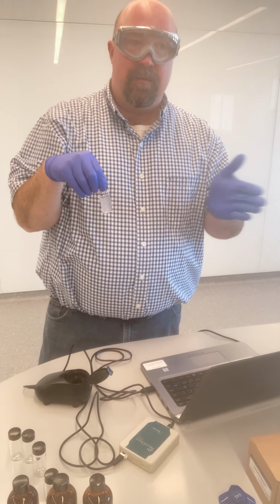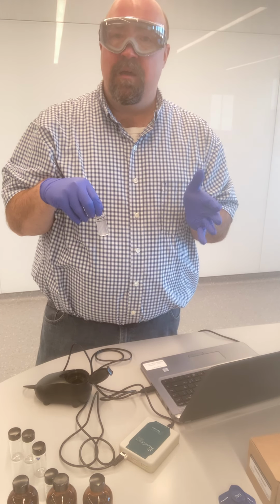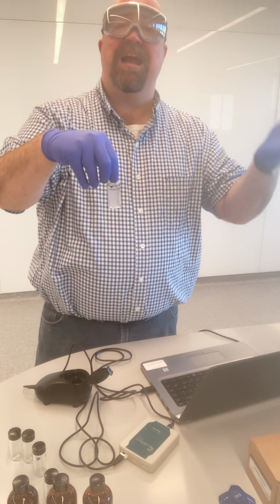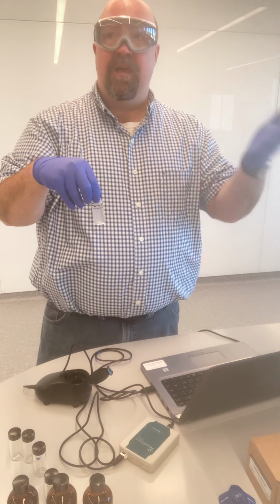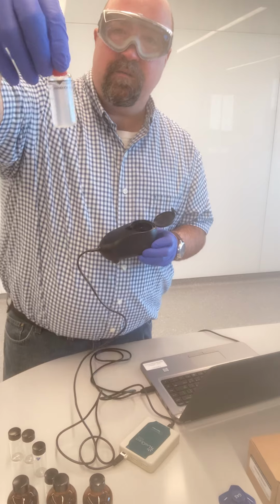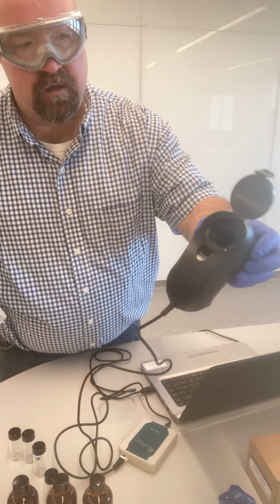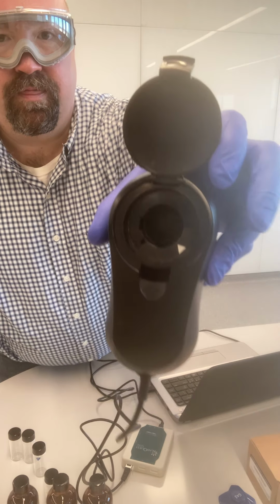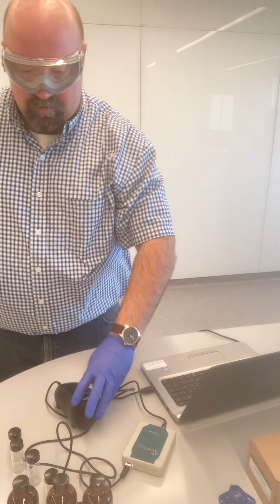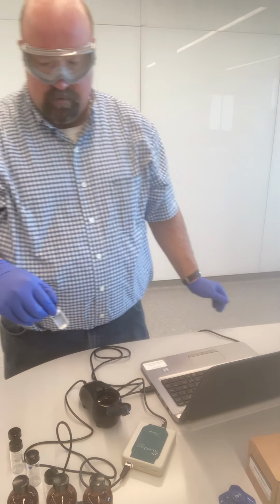And so yes, there might be imperfections that are interfering with the pathway of light, but if I put this in there the same way every time, then those imperfections impact the data the same way every time. And so it's not going to be a factor in the difference in numbers. And so you can see the arrow that's on the cuvette. I'm going to line that up with the arrow that is inside the meter. So I'm going to do that every time that I put a sample into the turbidity sensor.